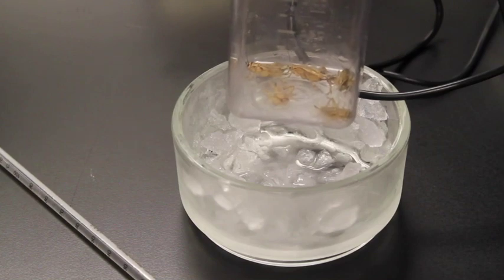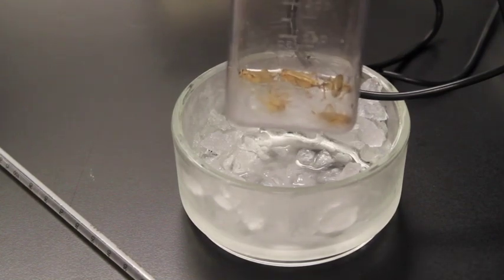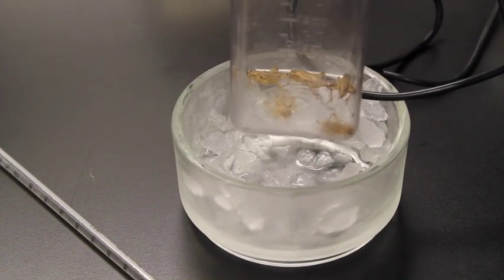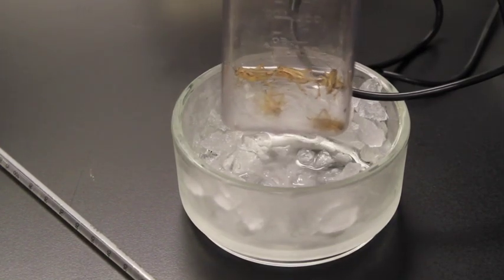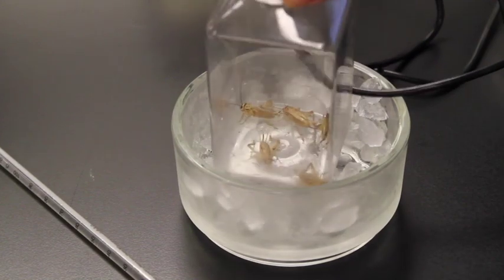And so, yeah, it's important to realize that this isn't really cruel to the crickets, because these crickets are different than people. So think about our hypothesis and think about what's going on physiologically with these guys that allows them to be put on ice and to cool down like this, and how that would be different than people.